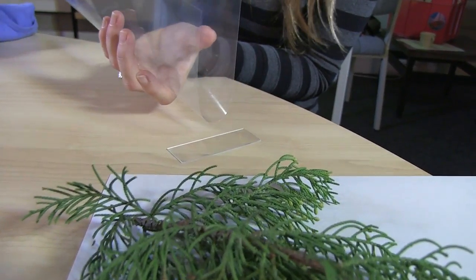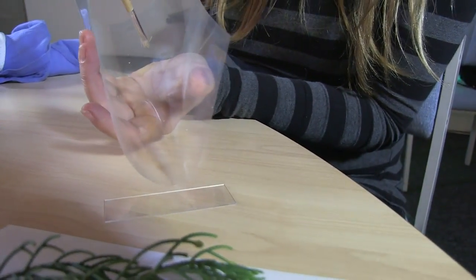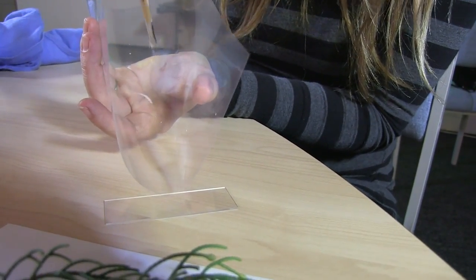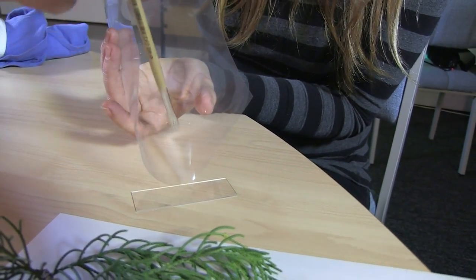And fold it up like so and with a brush we want to try and get some of that onto the slide.